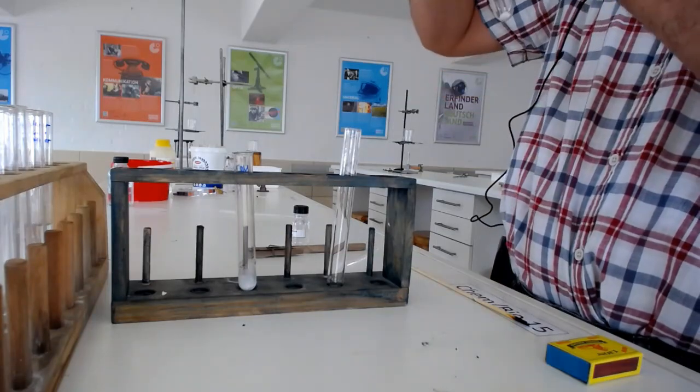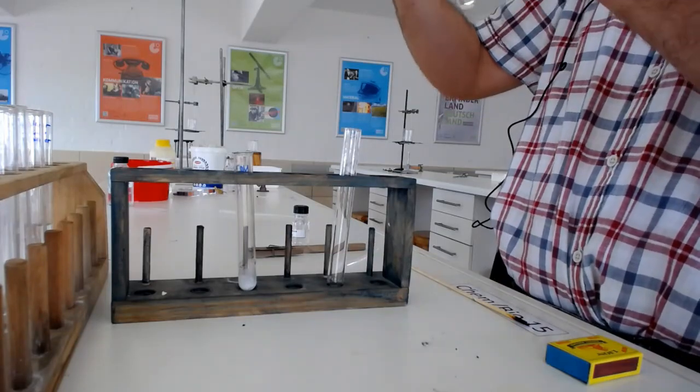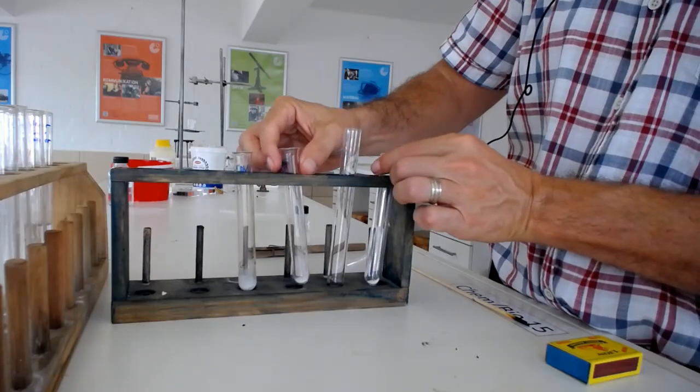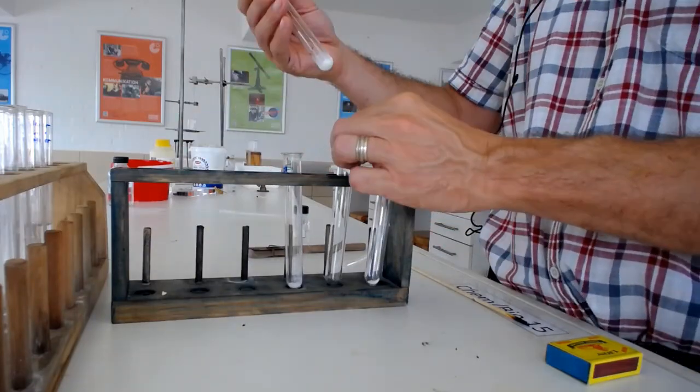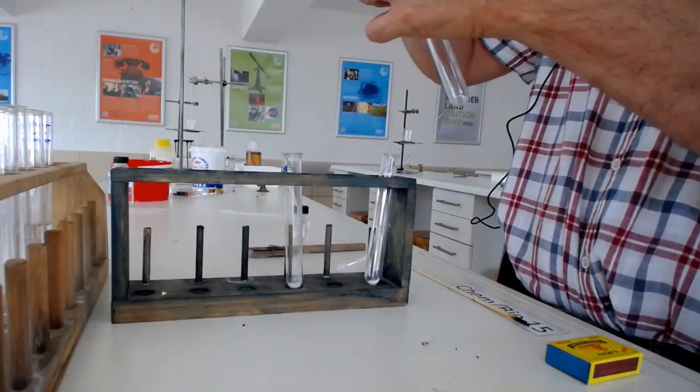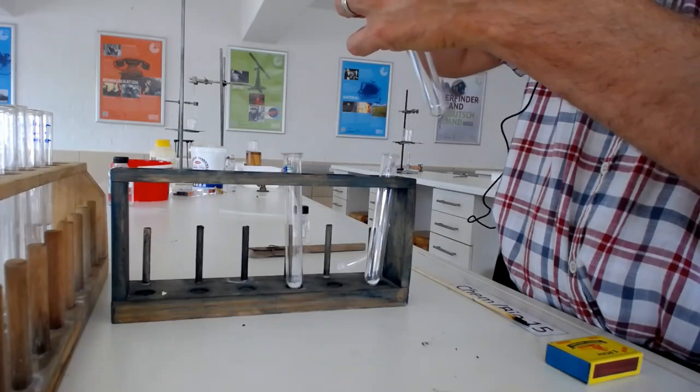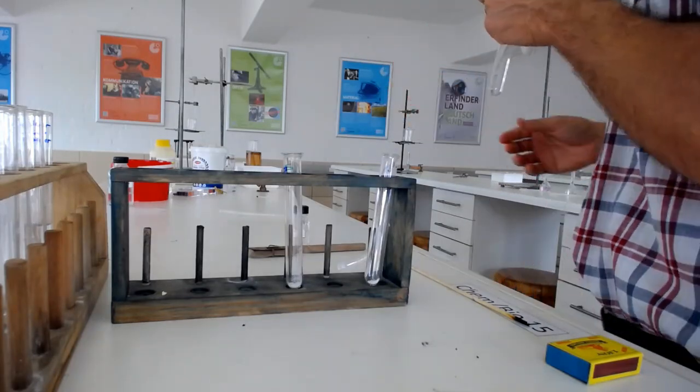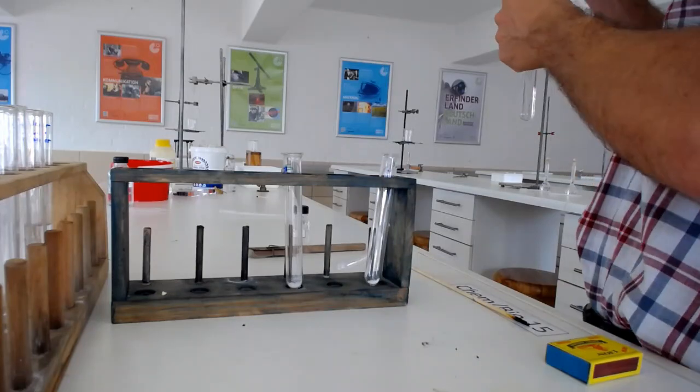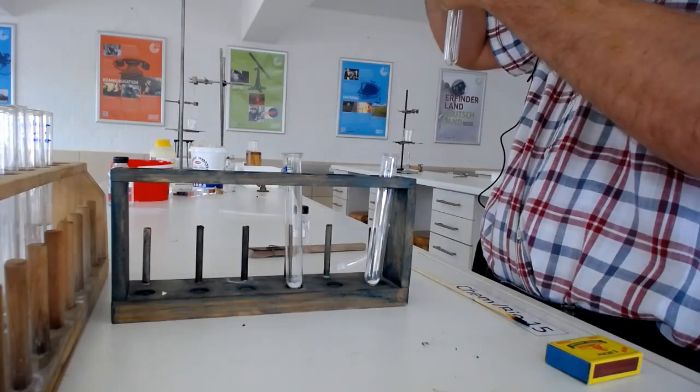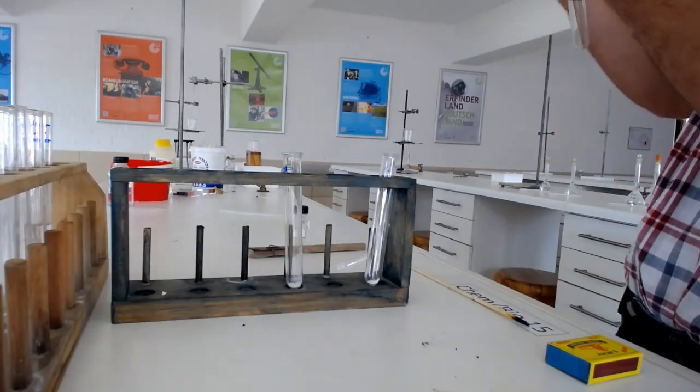Let's just get it out. So we basically separate it in two, my nitrate and my nitrite. Obviously you can't see which one is which. I know which one is which, and that's fine because this is the whole point of it, to distinguish between them. I'll tell you whether it worked or not.